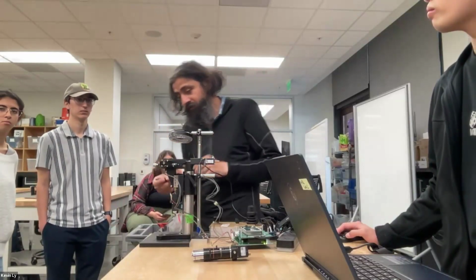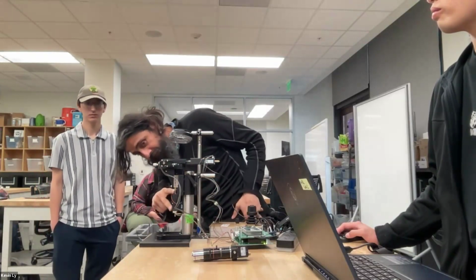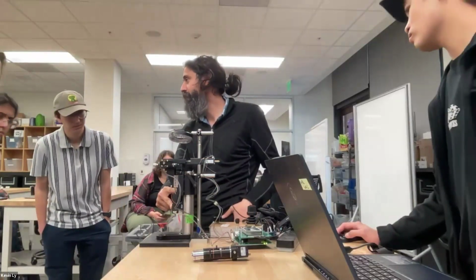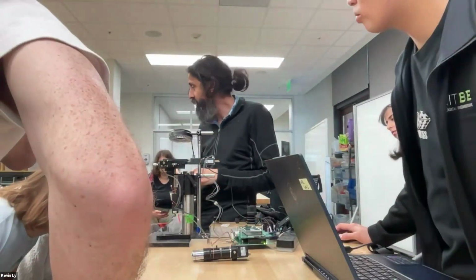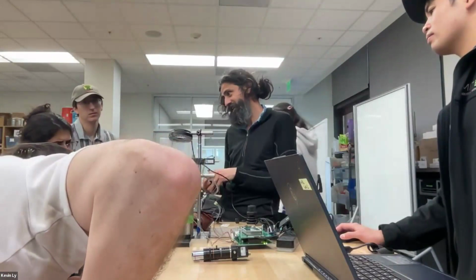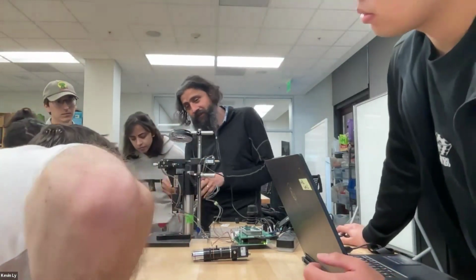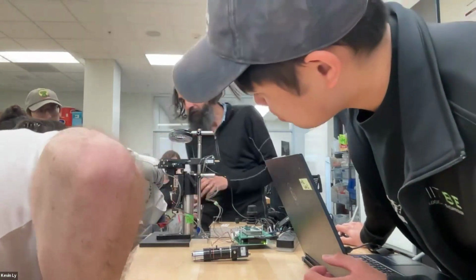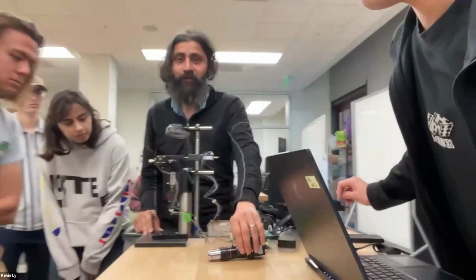So now we have, and you can see that there is another stage, but then can you identify there's something very special mounted on this? We just glued a piece. There is that golden piece that's only added on the Z stage. What could that be? It's almost as if a brick of gold. It looks like multiple bricks of gold. Can you show it to the camera?